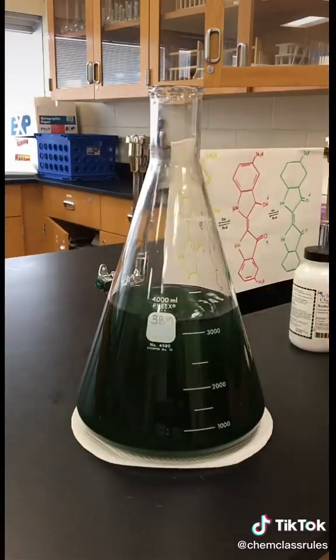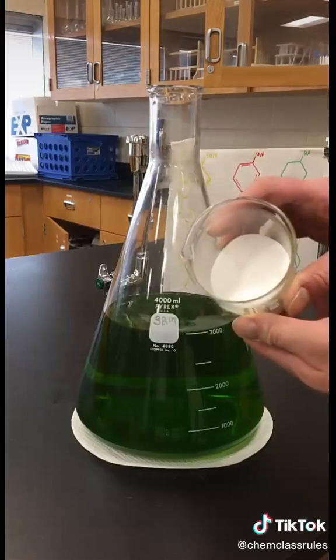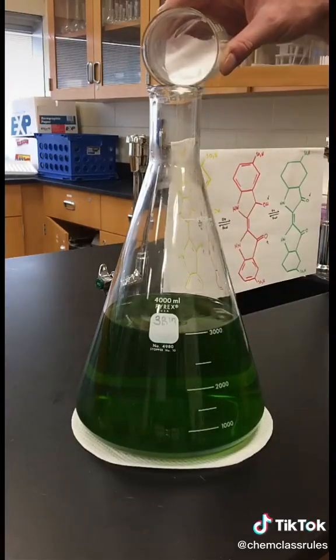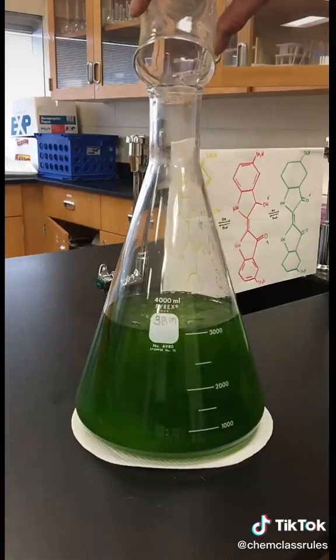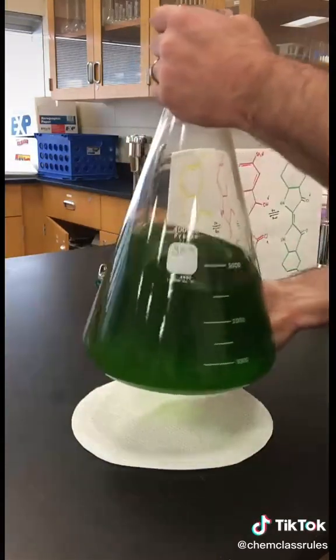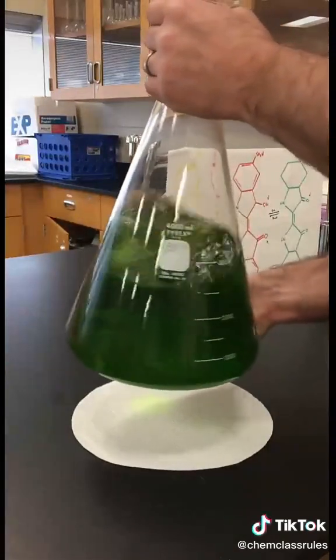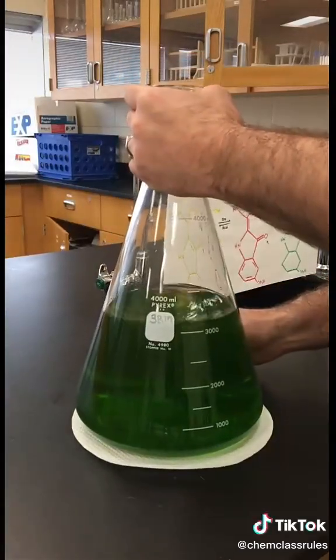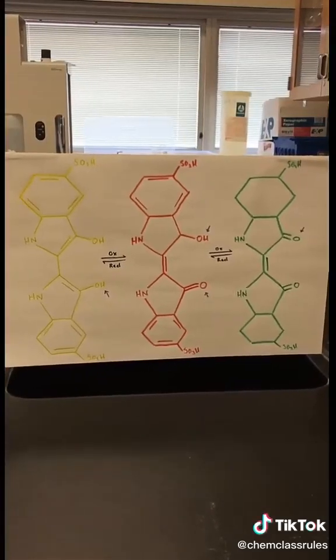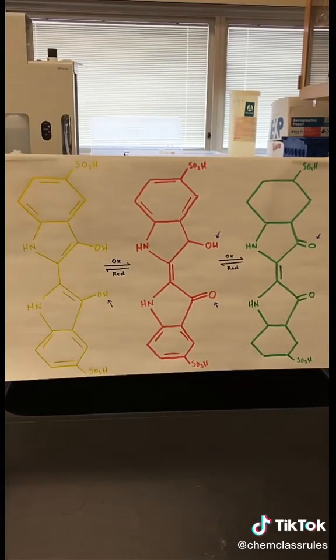The next thing we're going to add to our flask is going to be some sugar. It has to be glucose or dextrose, a reducing sugar. It creates what's known as a reversible oxidation-reduction reaction. When we shake the solution up we're adding oxygen to it, which oxidizes the indigo carmine from yellow to red to green. And then as the solution sets, the sugar reduces the indigo carmine from green to red to yellow. That's the reason for the color change.